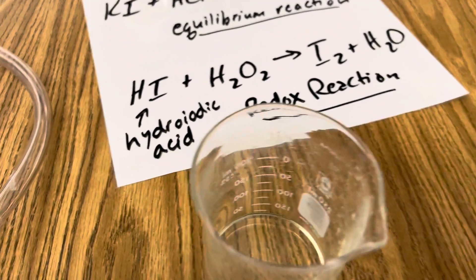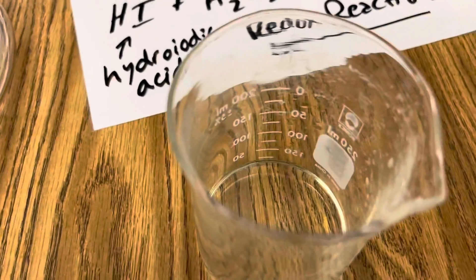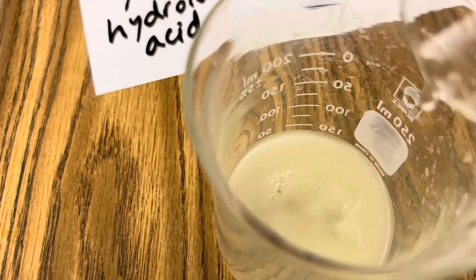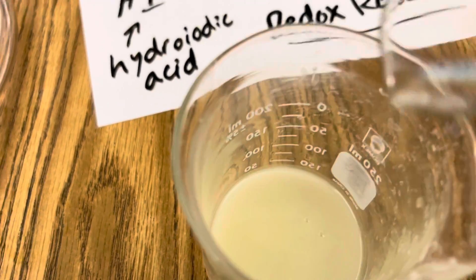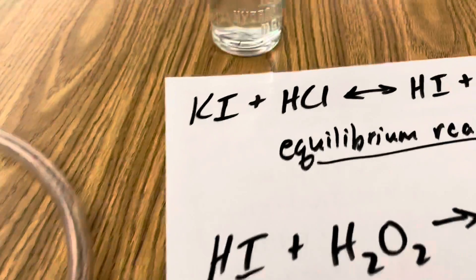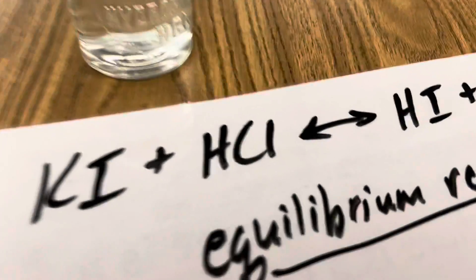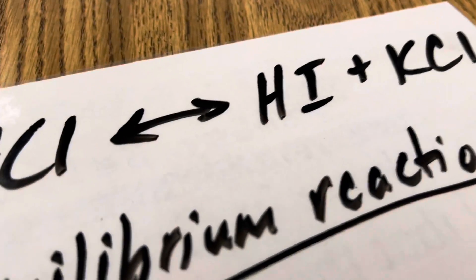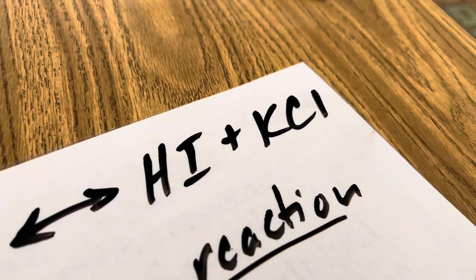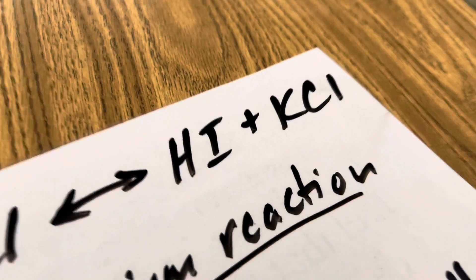And as you do this, what you're really creating is an equilibrium reaction. This is where your potassium iodide and your hydrochloric acid create hydroiodic acid and potassium chloride.